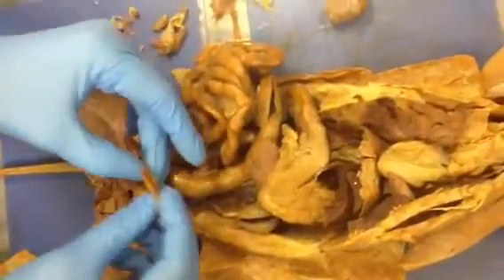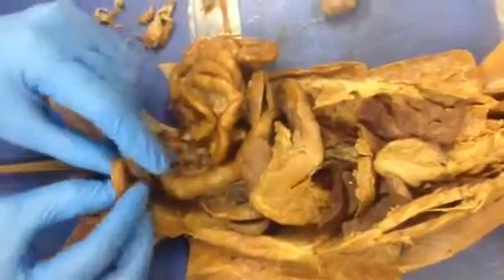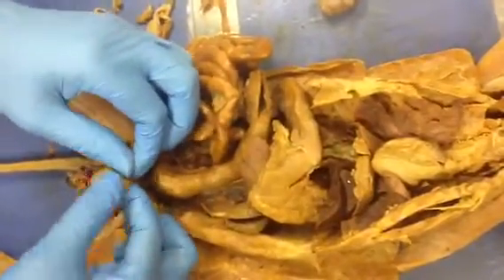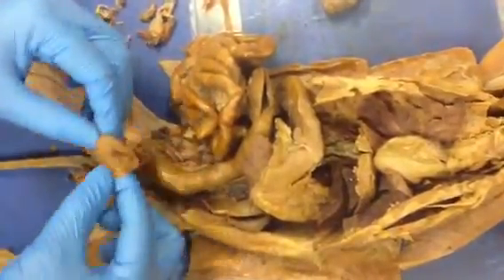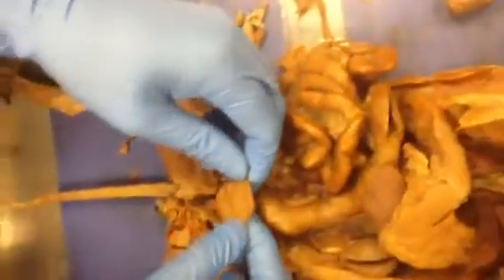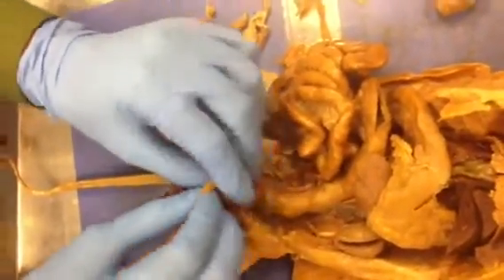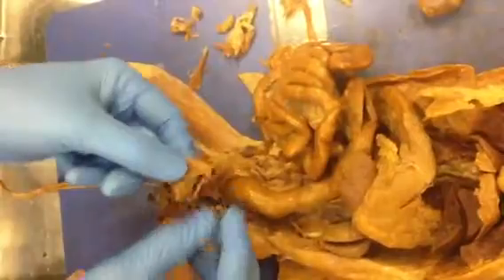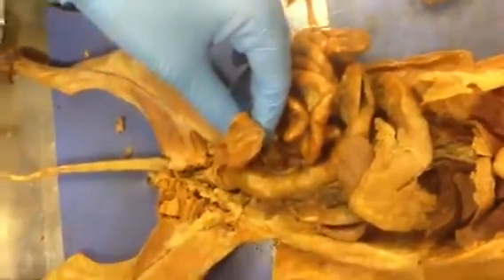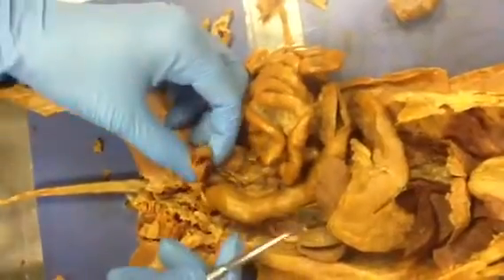And if we cut open the bladder, well, it's cut here. I'll just peel it. No urine. We don't have any rugae. Yeah, so you see these tiny folds, not too many, but you see some folds, which are the rugae. And the major muscle in the bladder is the detrusor muscle. Can we see the muscle there? Well, it's so thin, you can't see it.